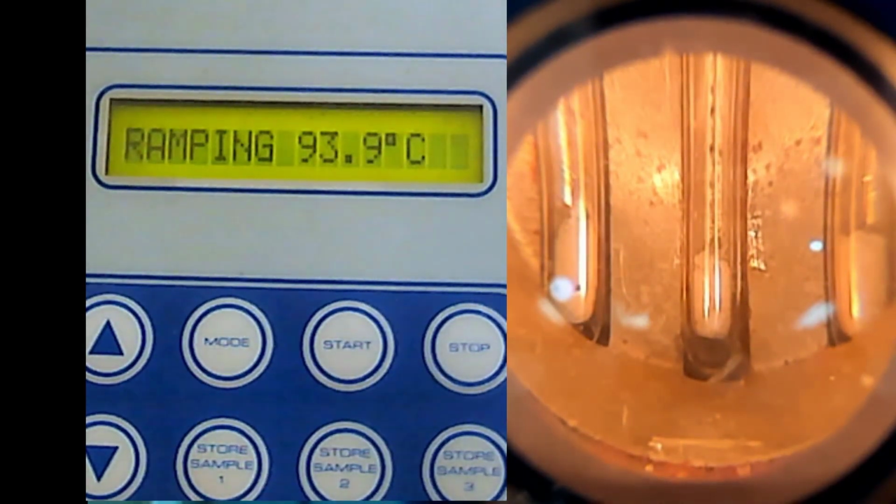By the way, the most important thing in your lab report is the discussion part. If you see, the mark on the discussion is much higher than the other components. So you look at that. Now just observe through the eyepiece.